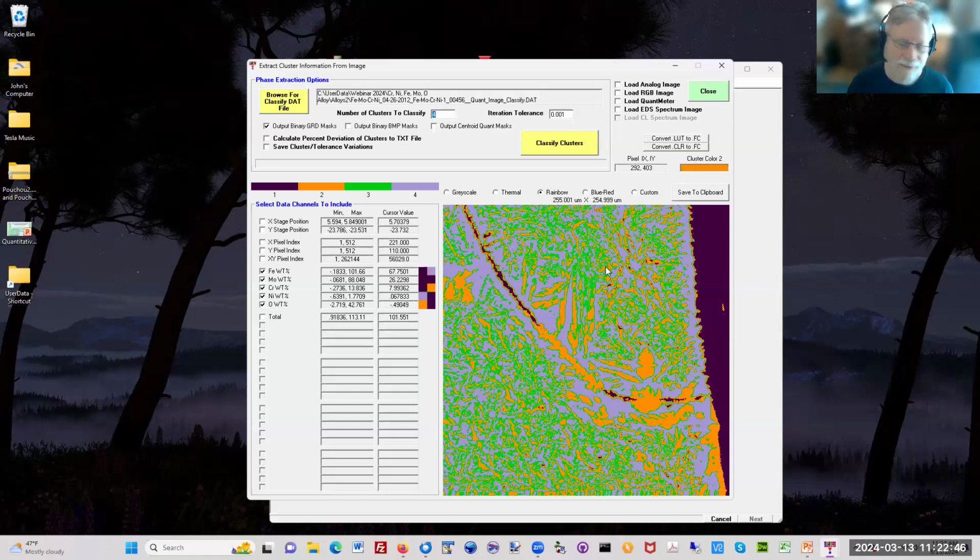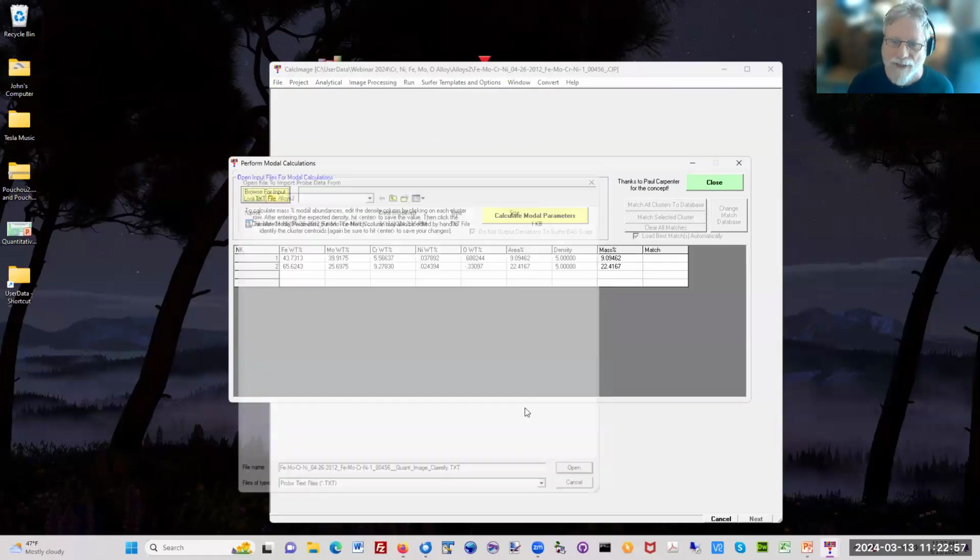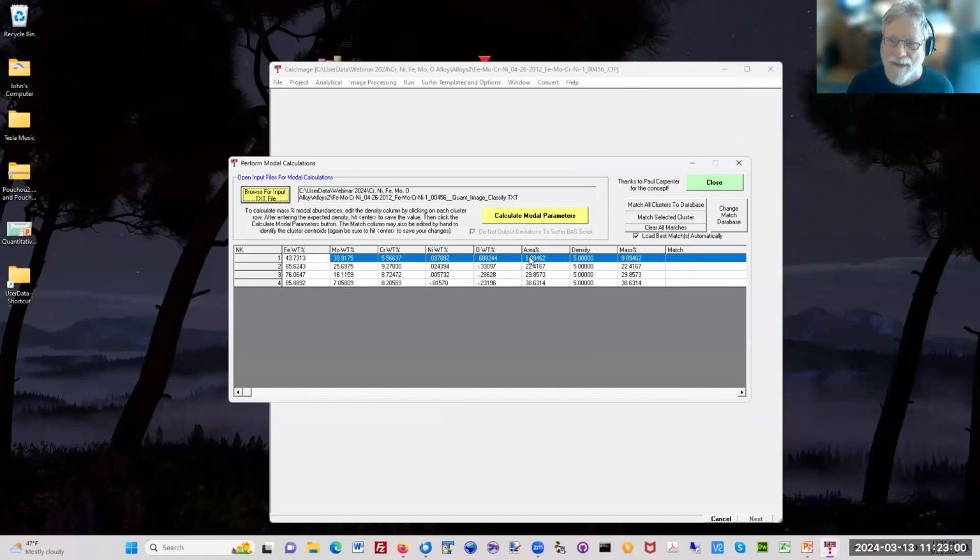This is basically a weighted k-means clustering method, and it's quite good. Once we have that, we can calculate modal abundances. Here is the area percent of each of those phases. If we want, we can define the density for each phase if we know it, and then we can even get the mass concentrations. Here I just assumed a density of 5, so it's not that meaningful. You don't see any difference between the area and the mass because they're all the same density. But if you have different densities, you get different mass. Some people feel this mass balance calculation is very useful.